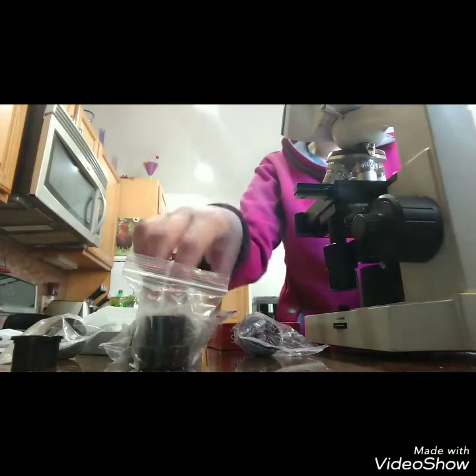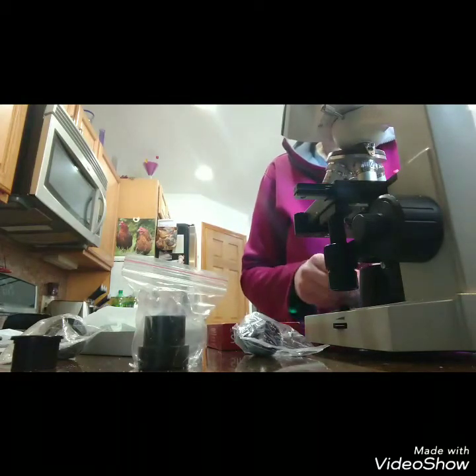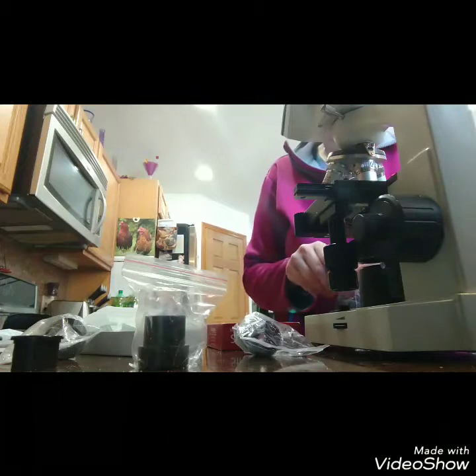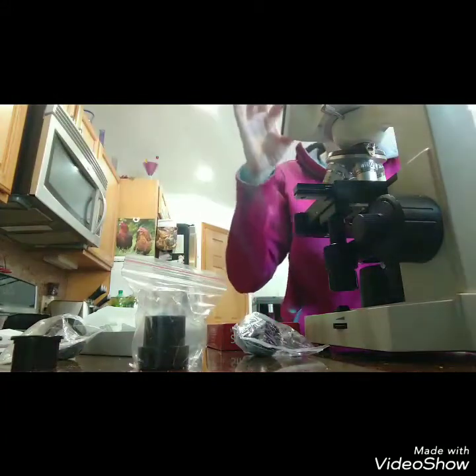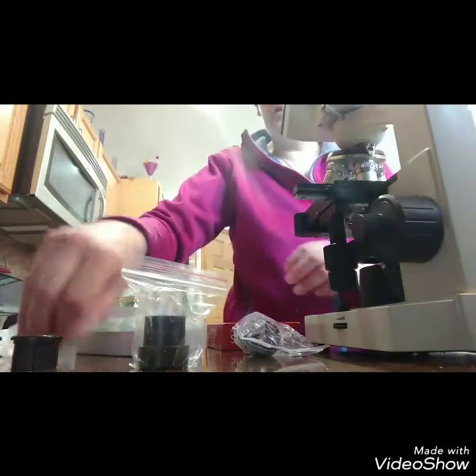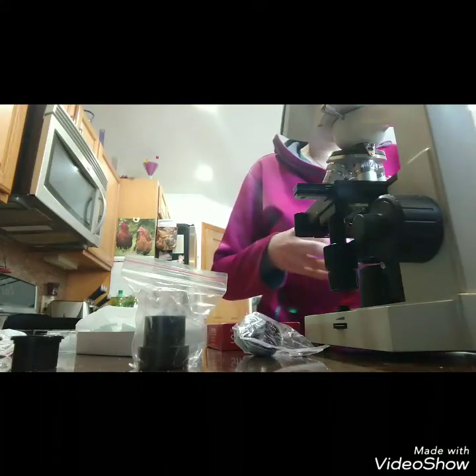When I first started doing this, I had one of my friends who are veterinary technicians train me on how to do this. So I'm going to take out the bigger eyepiece part and put it in so that it's all ready.